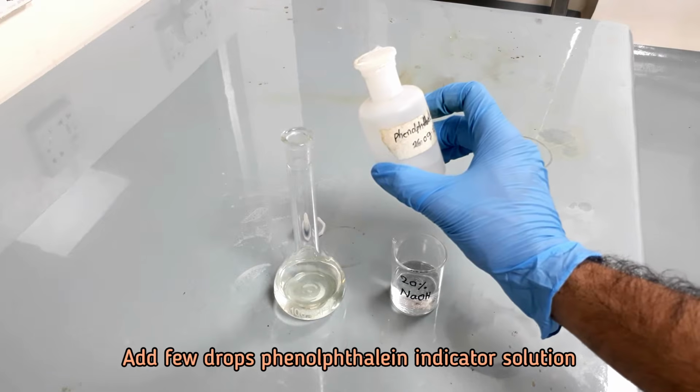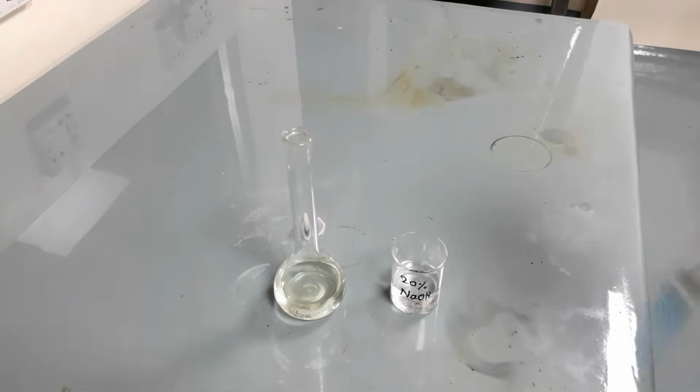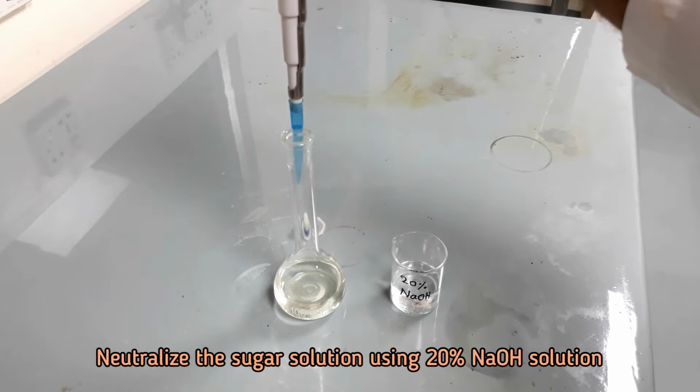After 24 hours, add a few drops of phenolphthalein indicator and neutralize with 20% sodium hydroxide solution.